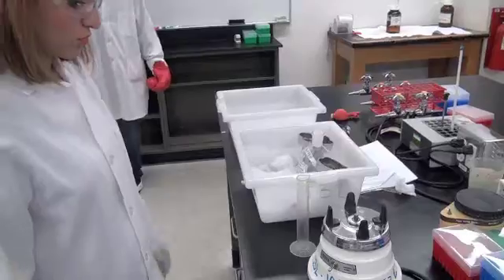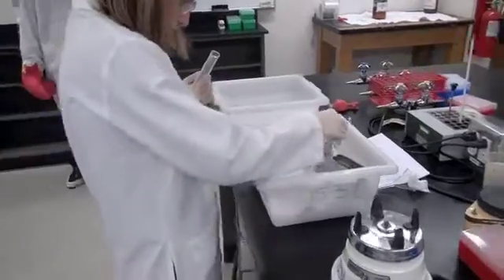The challenger is now obtaining her phosphate buffer, which she will add to her beef. Oh, isn't Challenger Curate getting the wrong phosphate buffer? That's correct. She should be using the cold phosphate buffer. The room temperature phosphate buffer is used for dilutions of unknowns for the assays. It should not be used for the blending step. Once again, increased thermal energy will cause proteins to degrade. Oh, I feel bad for Master TA.